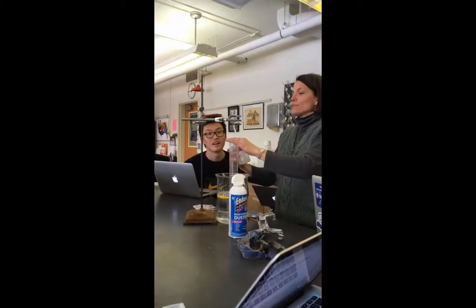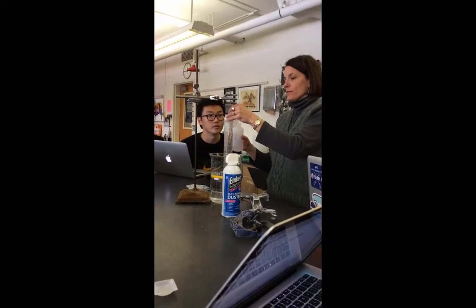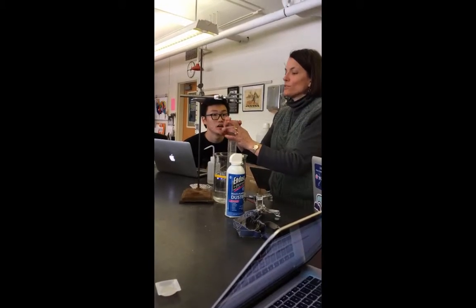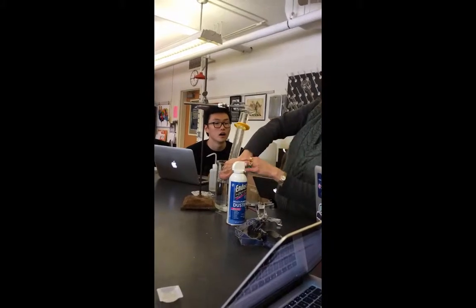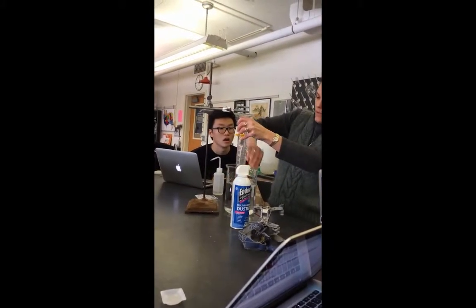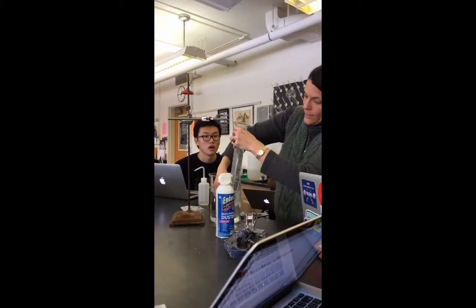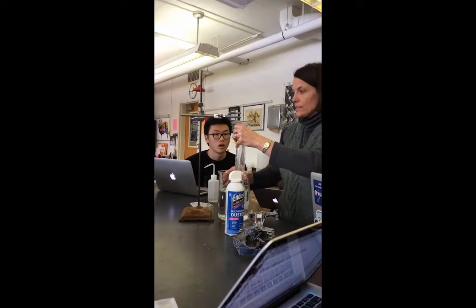Bubbles are bad. This is the skill part. You're going to do this next week in your final lab. Now, we're not going to obsess too much about the air bubble. It's smaller now. So we're going to use water displacement to collect our gas. And we've got a graduated cylinder, so we can measure the gas correctly. Stick it in there.